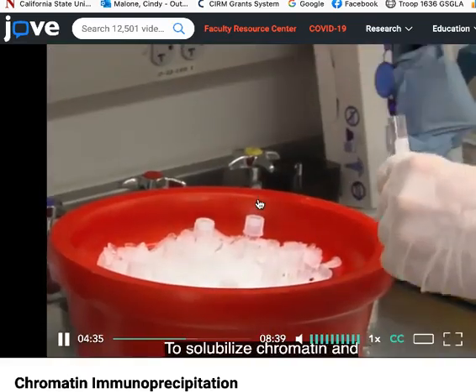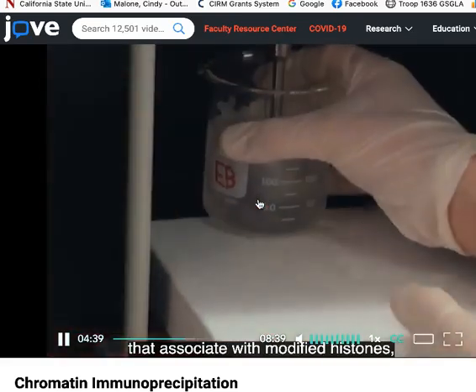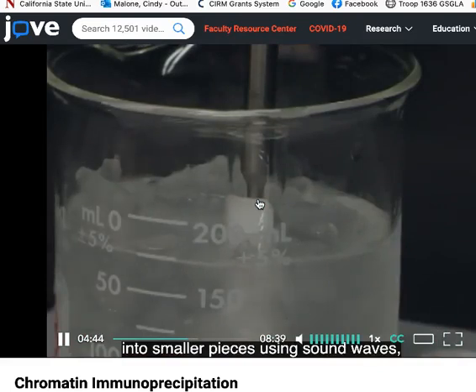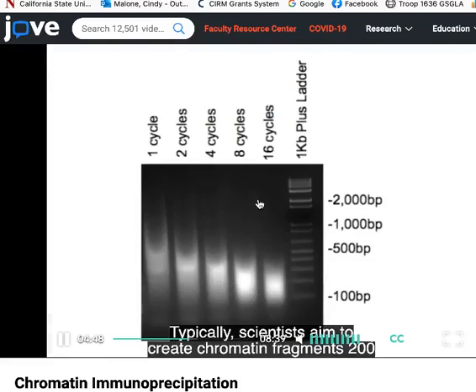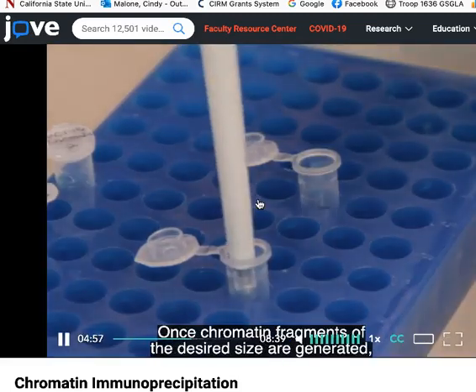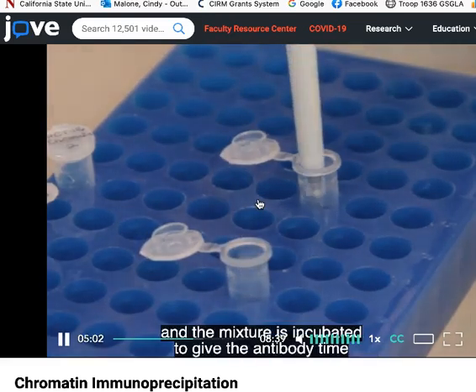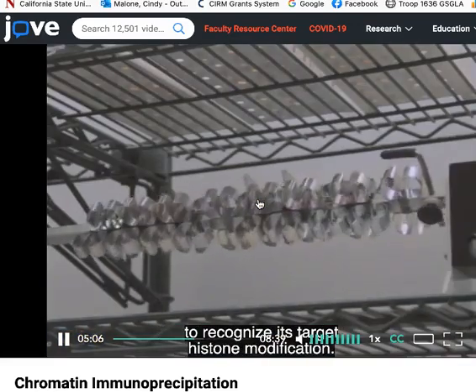To solubilize chromatin and precisely define the DNA regions that associate with modified histones, chromatin is mechanically sheared into smaller pieces using sound waves, a process called sonication. Typically, scientists aim to create chromatin fragments 200 to 1,000 base pairs in length. Once chromatin fragments of the desired size are generated, an antibody is added to the solution, and the mixture is incubated to give the antibody time to recognize its target histone modification.